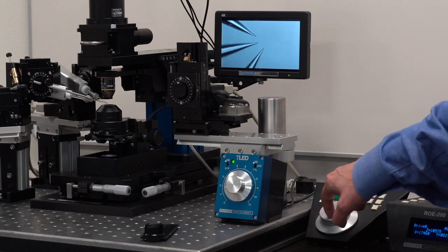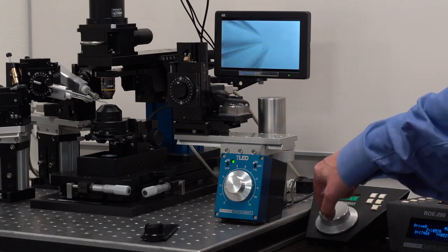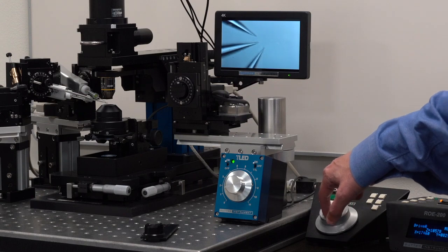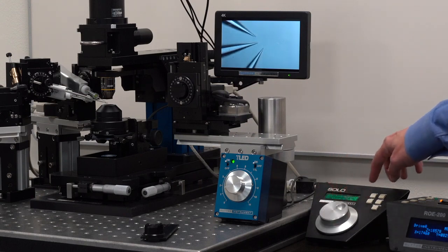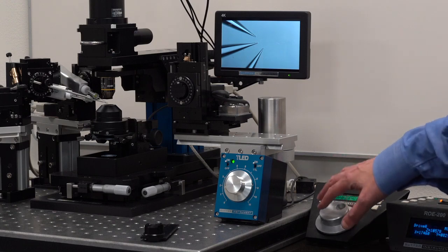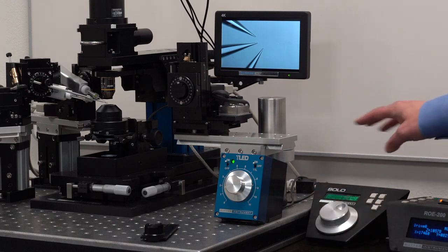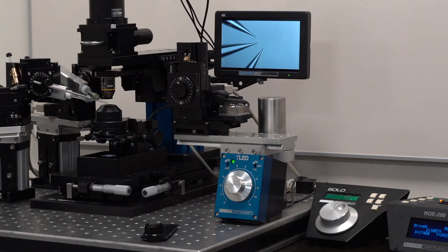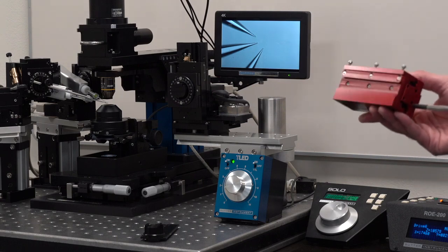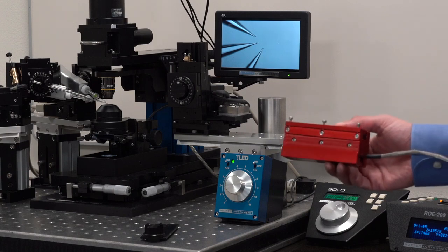You can see that all three pipettes go out of focus and then they come back into focus. I could have used the work position, which I have memorized here, and they would have gone robotically to those.